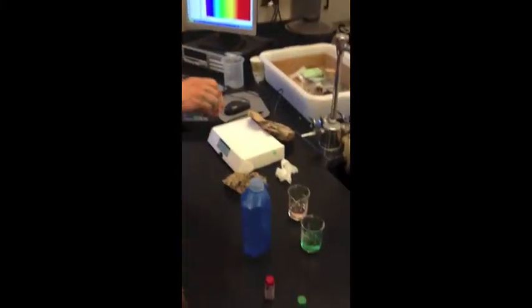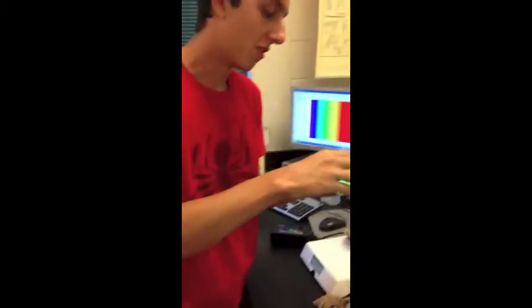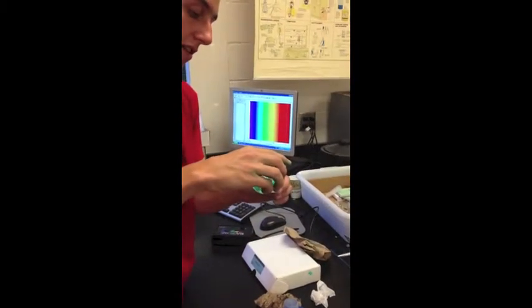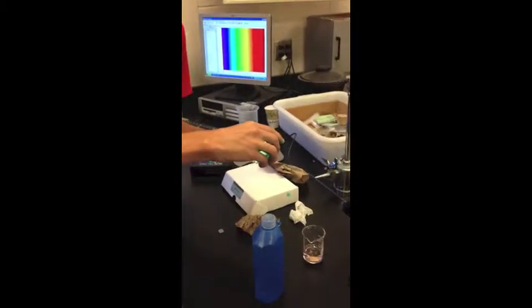Alright, so now that we've calibrated our cuvette with distilled water, we're going to put our solutions in. So, let's get rid of the distilled water, and we'll do this greenish solution that you might see has kind of exploded on me because I was being stupid. So don't be stupid. Fill the cuvette with solution, cap, shake, shake, shake, and pour it out. And we'll do that one more time.